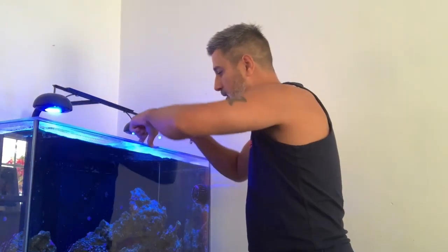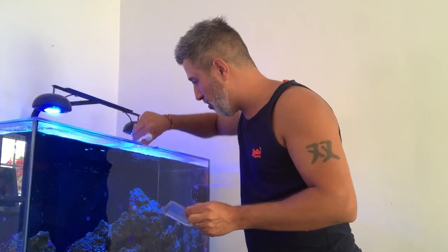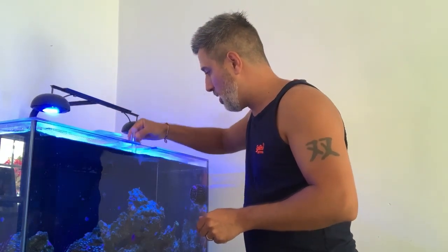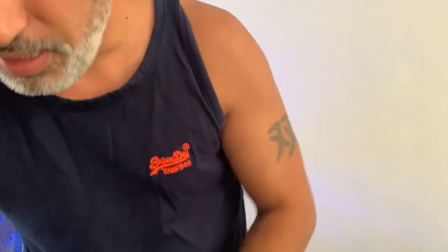The first thing we're going to do is get some water. We'll give the vials a little rinse first — not over the carpet! Then fill them up. I have just done a water change as well, so I don't know if I should have done this before or after the water change. We'll do the same for both vials — empty them out and fill them fresh.